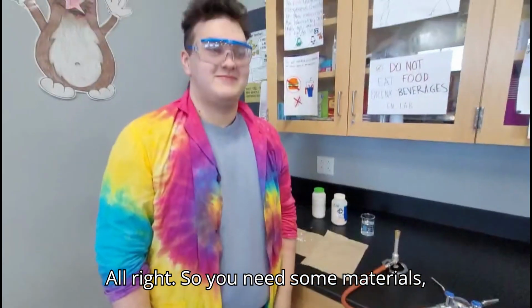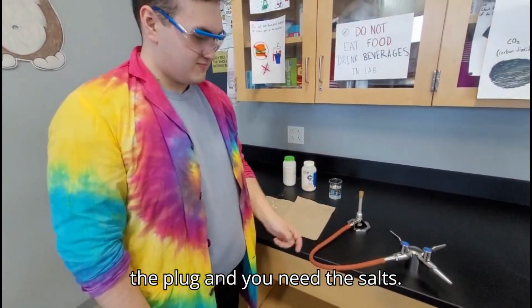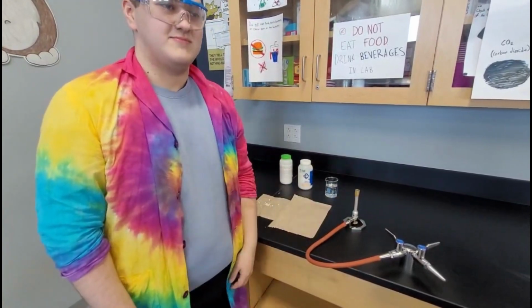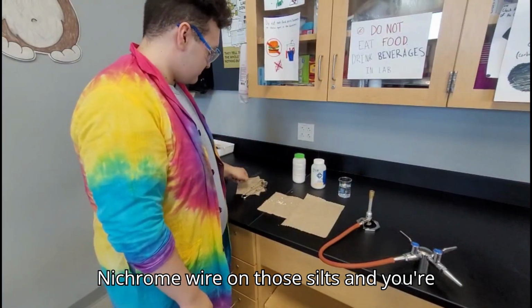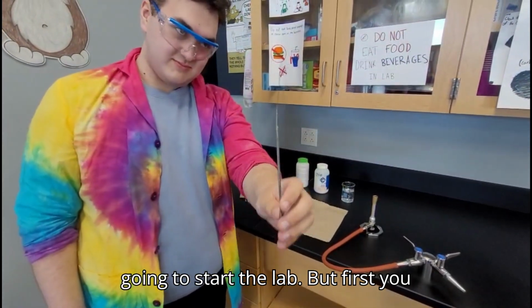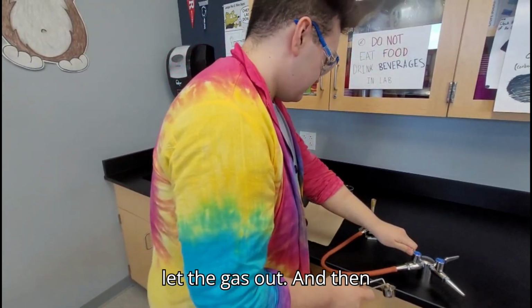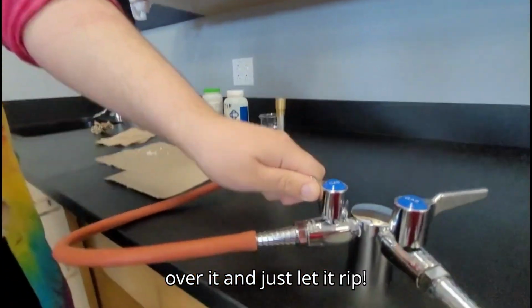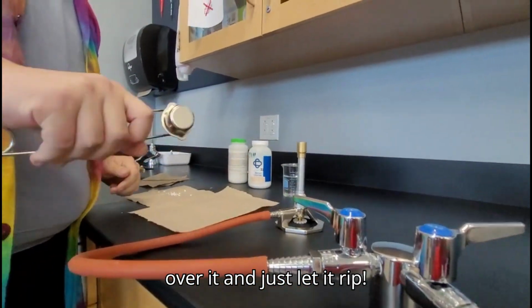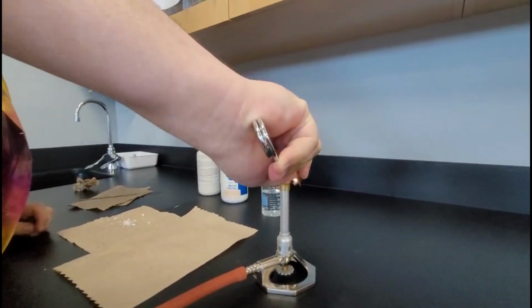Alright, so you'll need some materials. You need the Bunsen burner, you need the plug, and you need the salts. Then you're gonna have to take your nichrome wire to those salts, and then you're gonna start the lab. But first, you have to start the fire, turn the lever, let the gas out, and then you're gonna put the flint starter over it, and just let it rip. Boom!